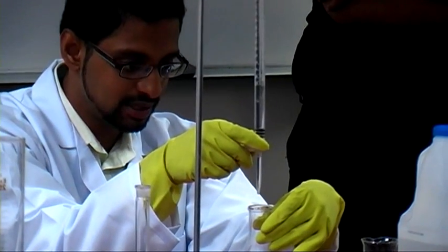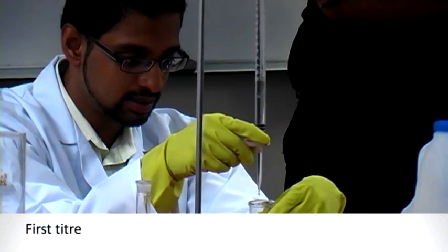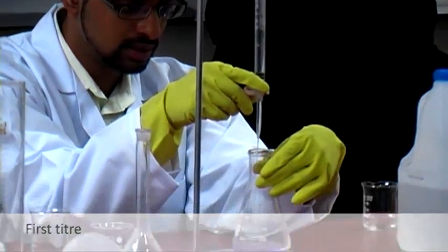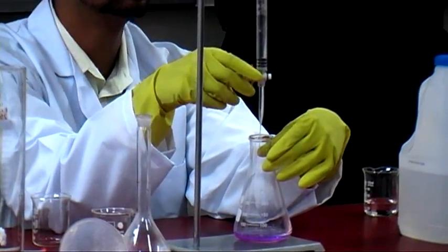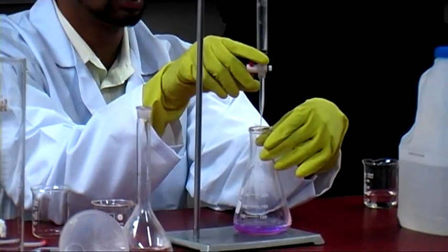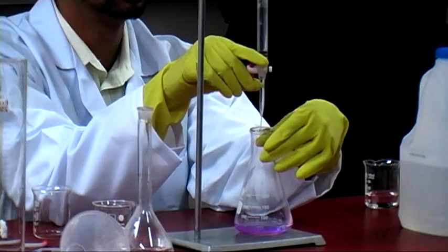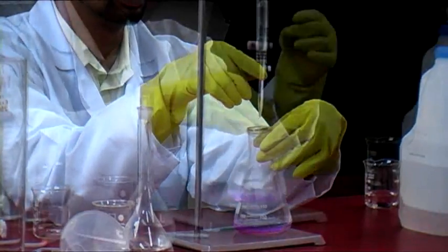You see, I'm still wearing the gloves, still wearing the lab coat.